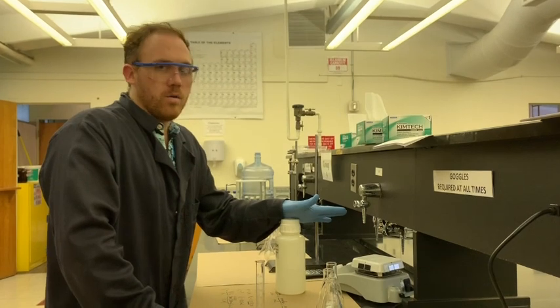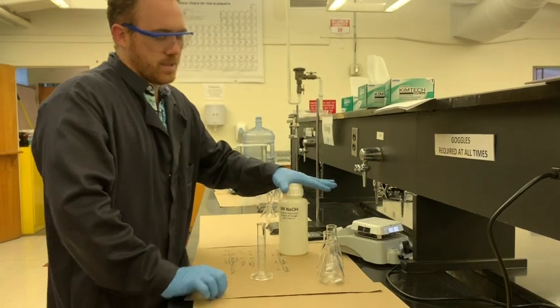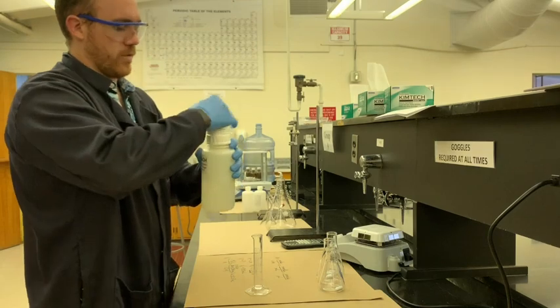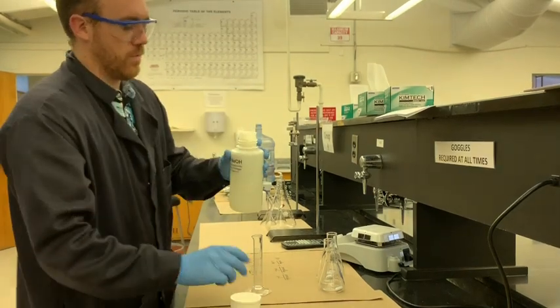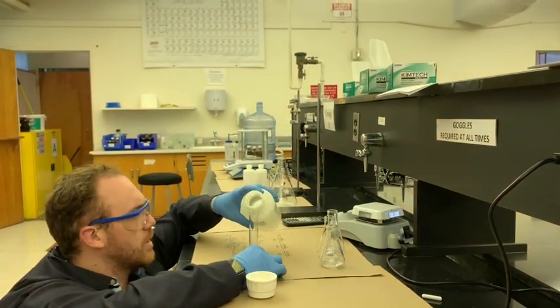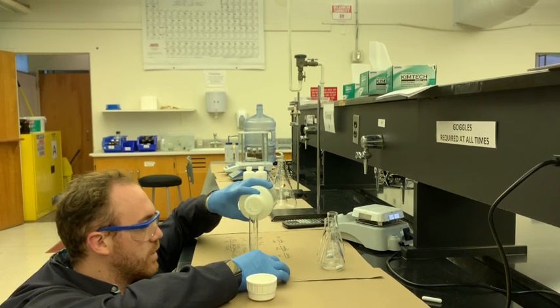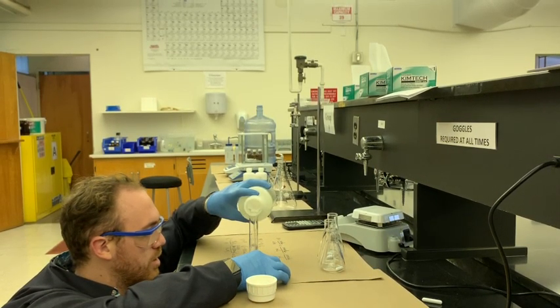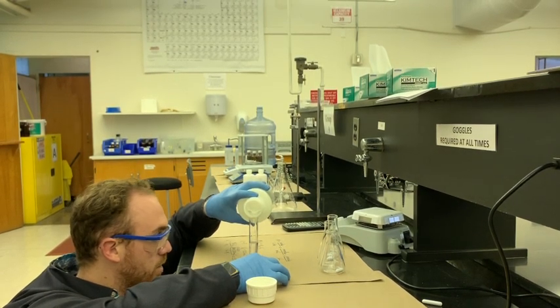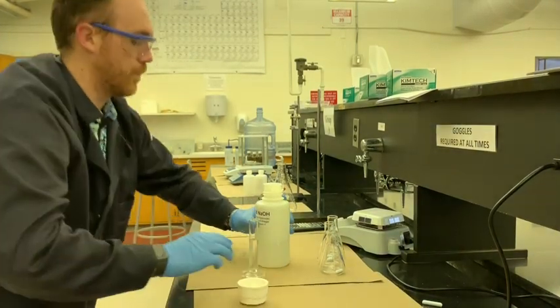So what we're going to do now is take some of the 6 molar NaOH, and what we're going to add to this graduated cylinder is exactly 20.8 milliliters. So we have this whole volume. Just going to measure it out. You should try to measure it out as carefully as possible. This is probably not the best container to use. It's a little bit big, but just be careful not to spill any of this NaOH in your eye. You want to get as close to 20.8 as you can, just so we are working with roughly what we thought we were.